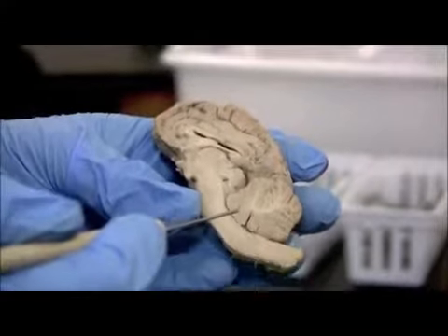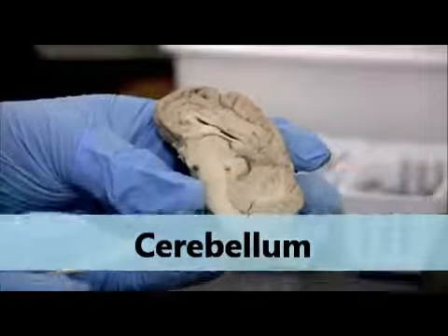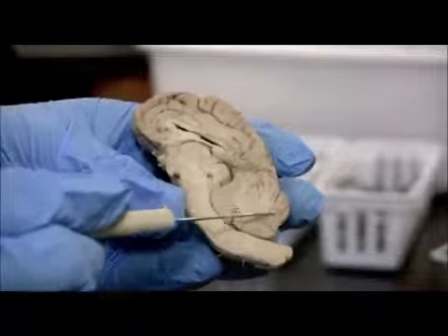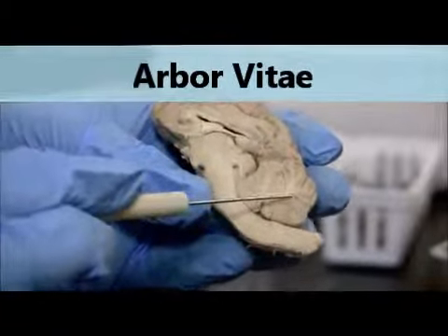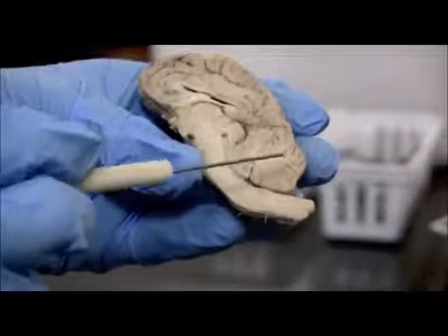Okay, here is another brain half. We're looking at the cerebellum now. This white matter, these little tree branches that you see coming out, white matter into the gray matter, those are the arbor vitae, the tree of life. And that's the white matter within the gray matter.